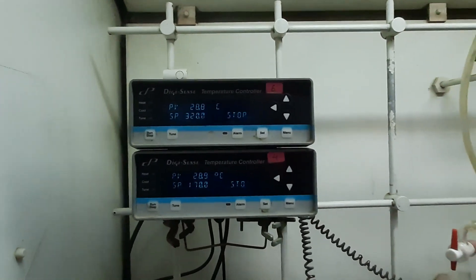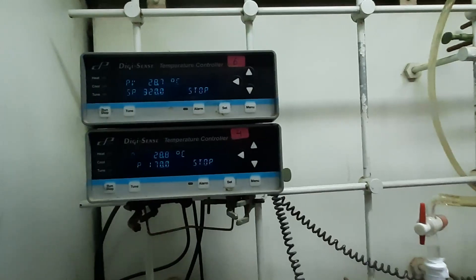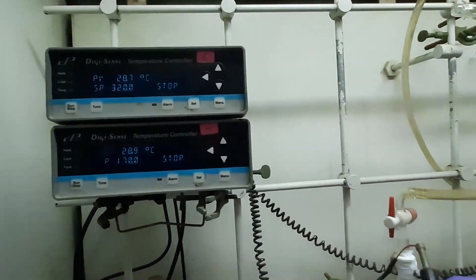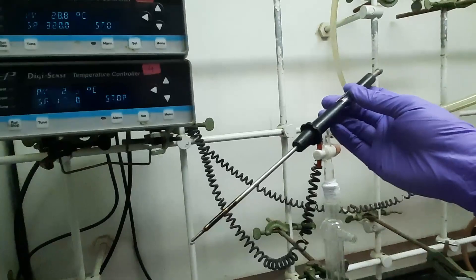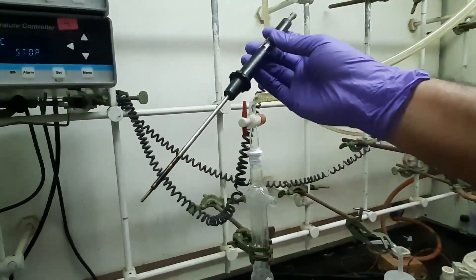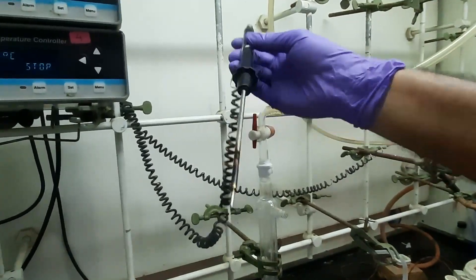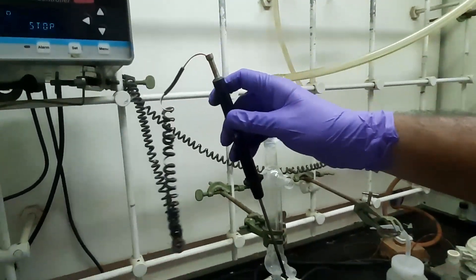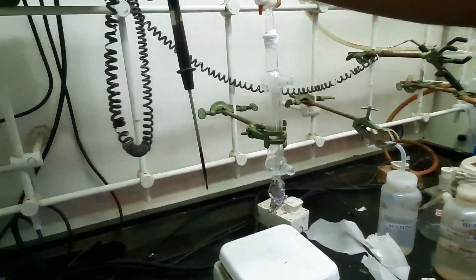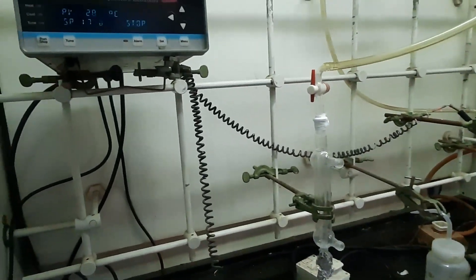The second thing required for the synthesis is a temperature controller. This one is a DigiSense temperature controller manufactured by Cole-Parmer, and this is the temperature controller sensor. The tip of this sensor goes into the reaction medium and gives feedback to the temperature controller to maintain a constant reaction temperature.